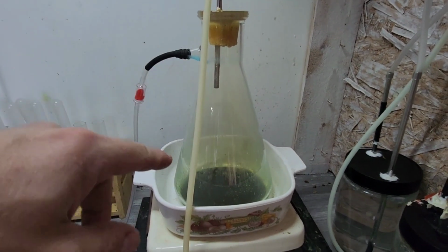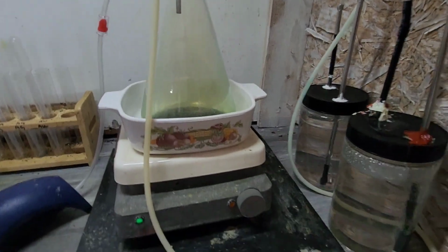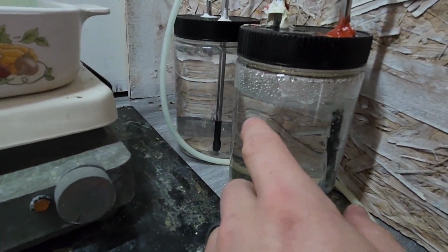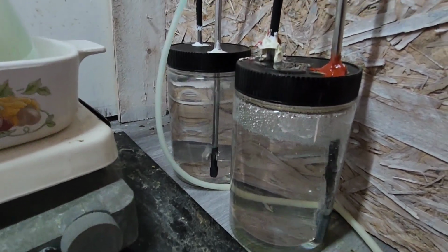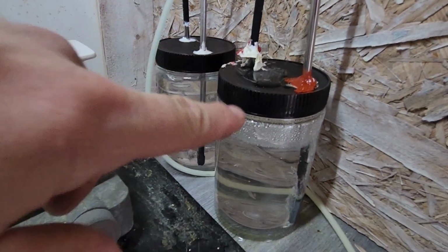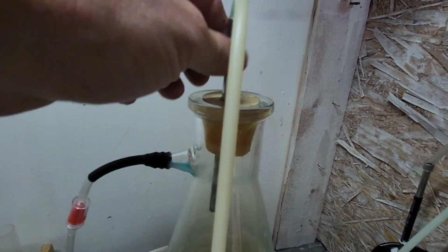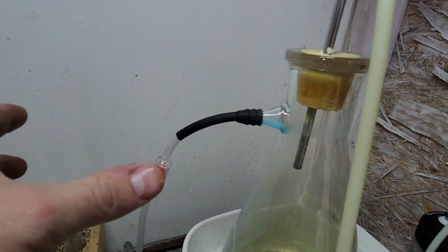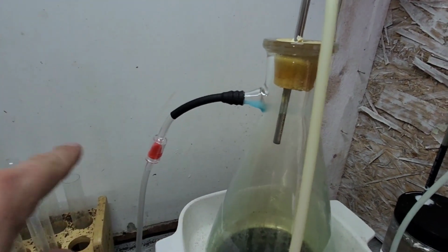This is finished up. It's ran through. A couple of problems. First one, I need an expansion tank, right? So basically a sealed container whose sole purpose is to catch the overflow liquid here. I could see myself upgrading to three of these and then just doing this. It's real easy in and out. And then I could pipe another one next to it, seal it off so that any excess water will just drain into the next one.